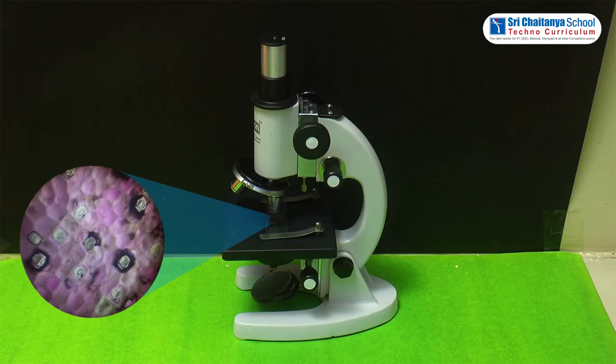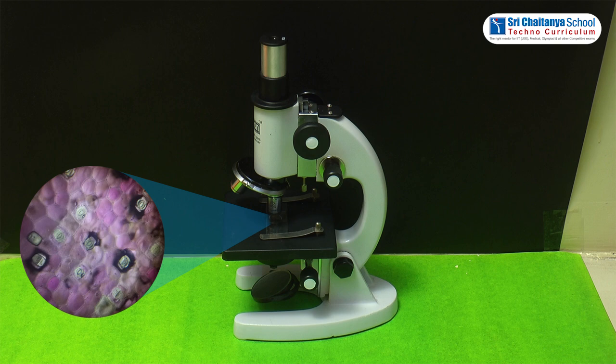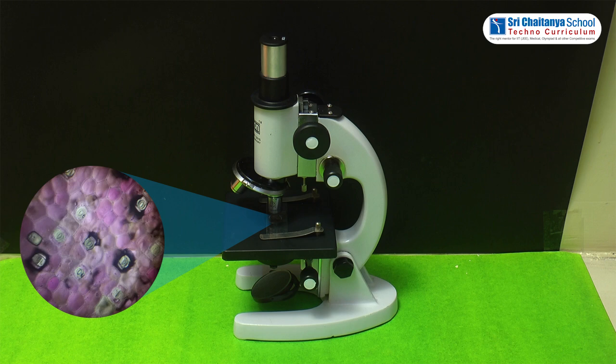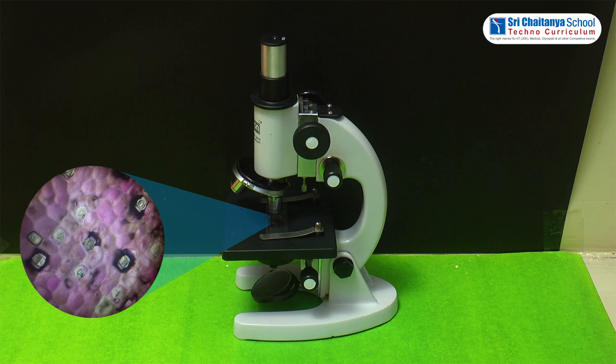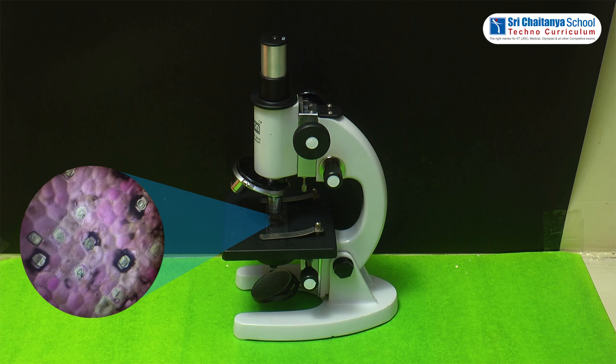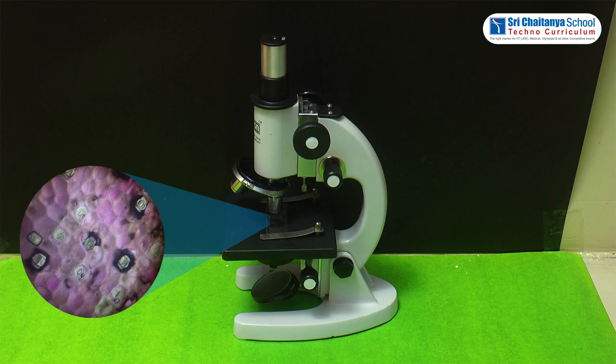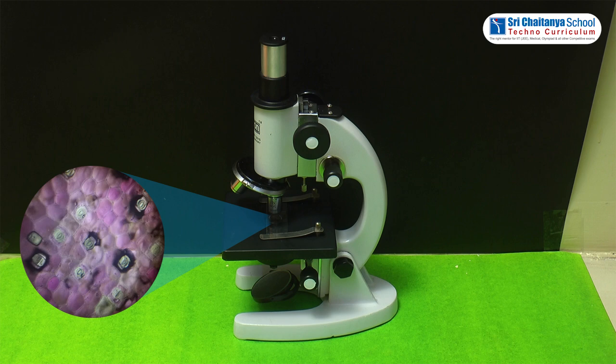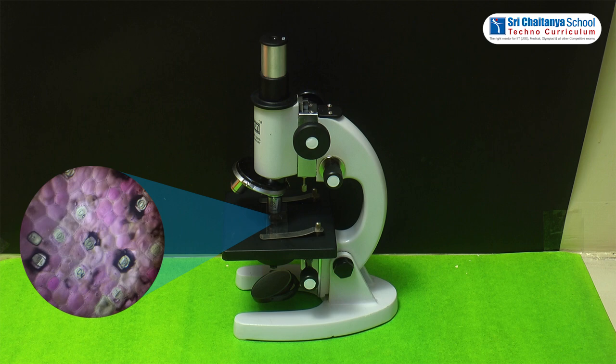We observe that the epidermal cells are compactly arranged and small tiny pores are visible among them. From this experiment we conclude that the epidermal cells are compactly arranged without intercellular spaces. The green tiny spots visible in the epidermal cells are stomata, which help in the exchange of gases and transpiration.